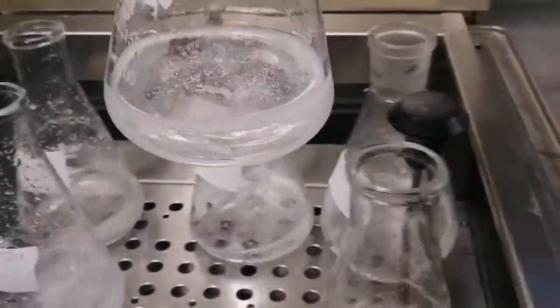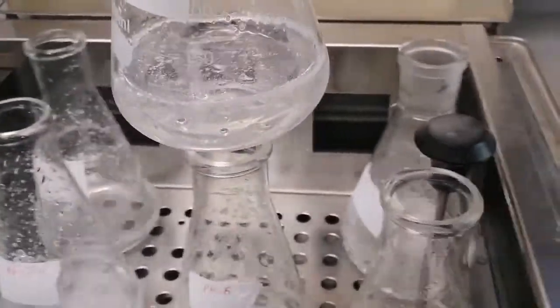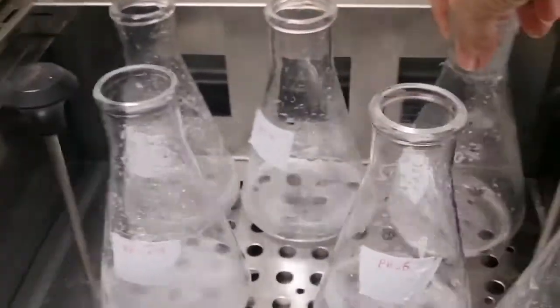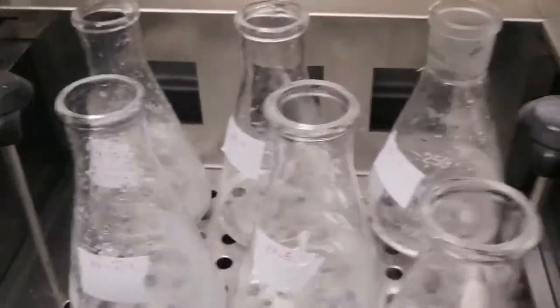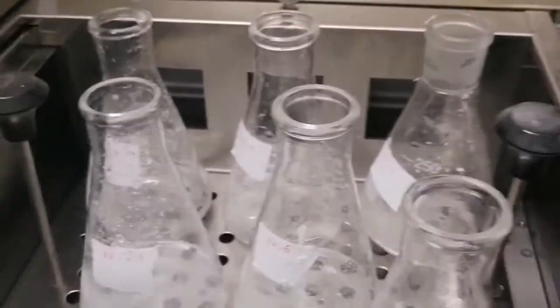Now the 15 minutes is up, and as we can observe, the mefenamic acid is not completely soluble in these flasks, and it's more like another layer on the liquid media, as you can see. So now we will filtrate these solutions in order to get rid of excipients or any undissolved particle, as a UV spectrophotometer won't measure these solid particles, it only measures the solutions.